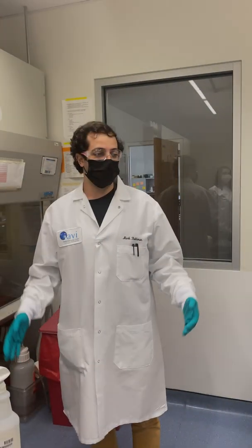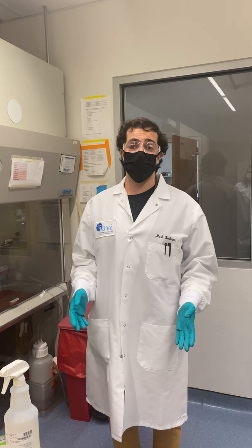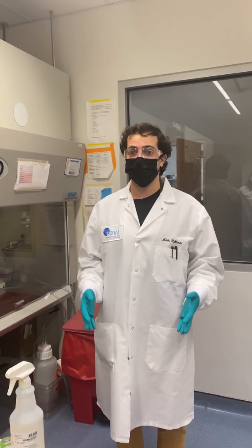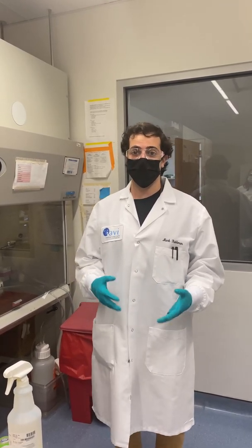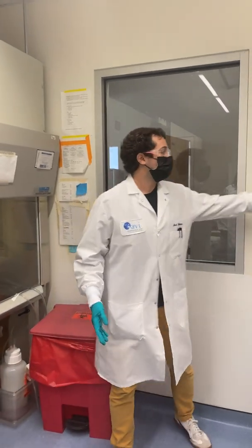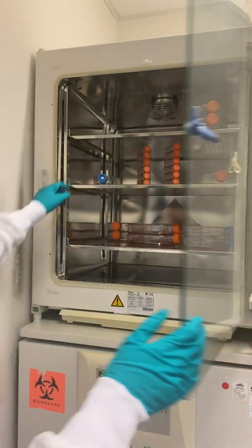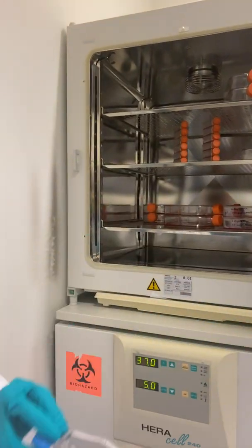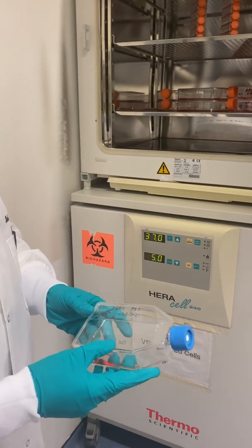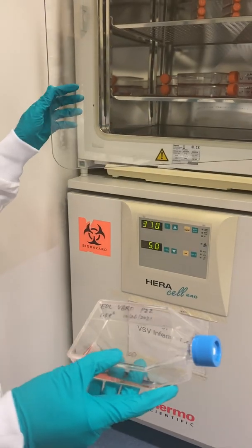This is one of the lab rooms where we grow out our cells. All the work that we do here requires us to have healthy cells so that we can learn how the viruses that we're working with behave inside of the cells. We grow our cells in these incubators, and they grow in these flasks that come in different sizes. Usually it takes a couple of days for them to grow, and then once they're ready, we can do an infection.